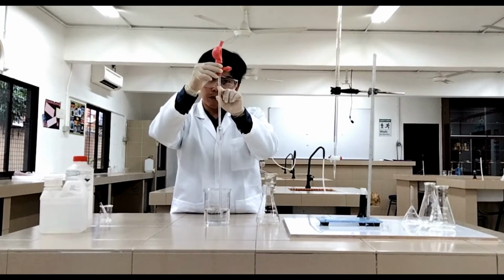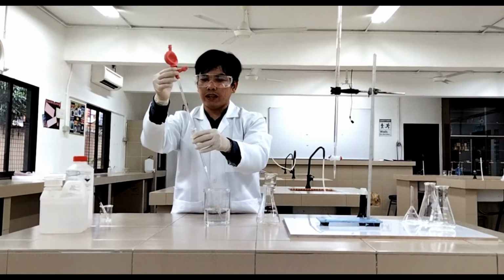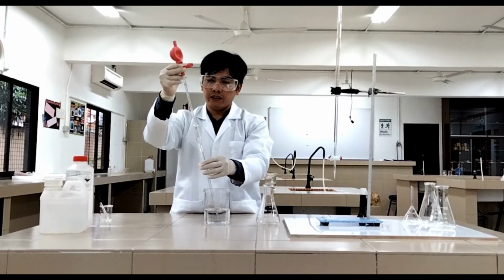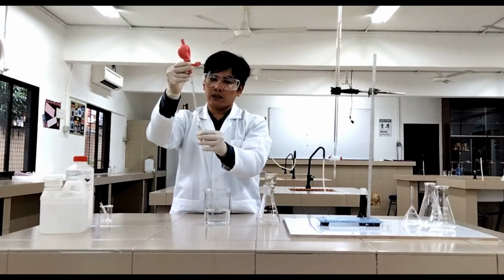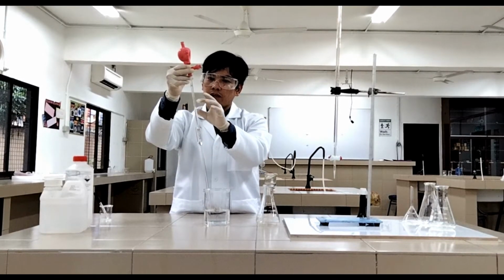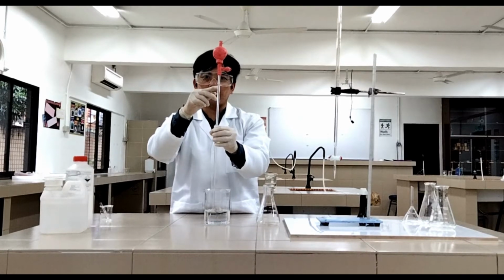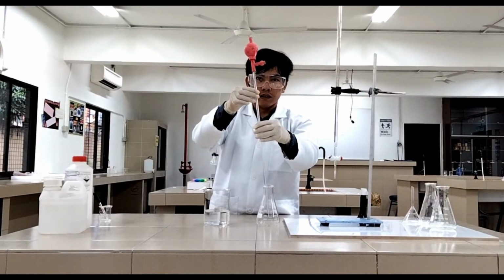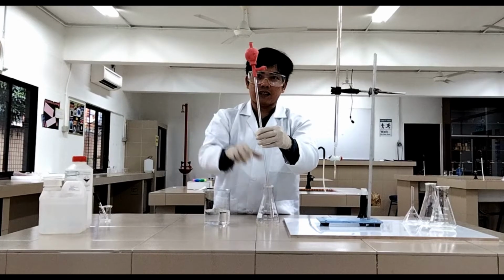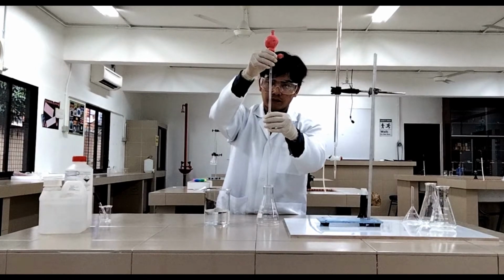In this pipette, you will see a blue line. This blue line indicates that it's already 25 ml of the acid. Okay, so let's start. Press S. Now, if you observe, the liquid is going up here. If you can see it on the video, the acid is going up. So we're going to have it until that blue line. Okay, now it's at the blue line already. Now we can transfer the exact amount of 25 ml or cm cubed of the acid into the flask. Let's press E, transfer it here in the flask until the last drop.